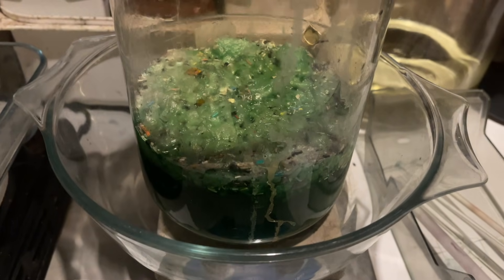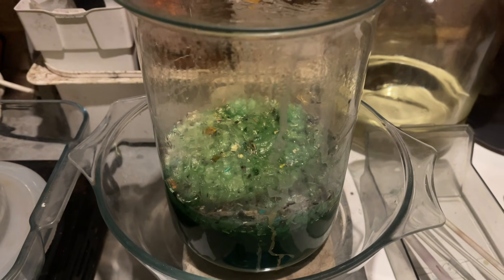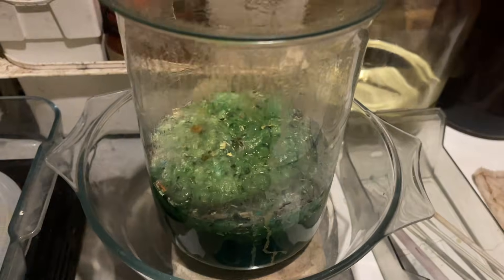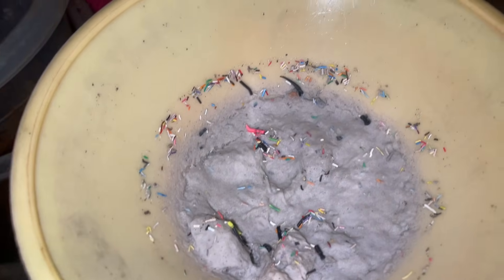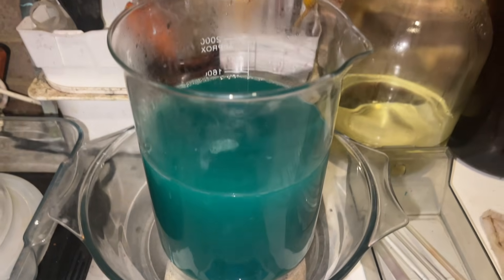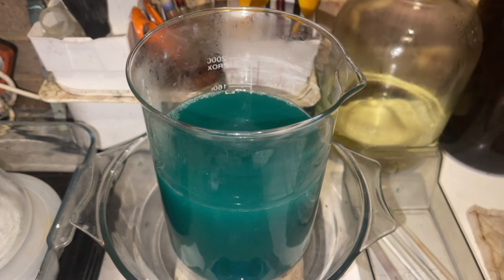This has been put in aqua regia now and it's been on boil for about three hours. What I'm going to do is filter it and let's see if we've got any gold in there. All these filters have been put together, they've been put in aqua regia. This is the dirty solution that we've got. I'm going to try and drop to see if we get any gold — there should be some gold there. Then we'll have to do another clean-up.